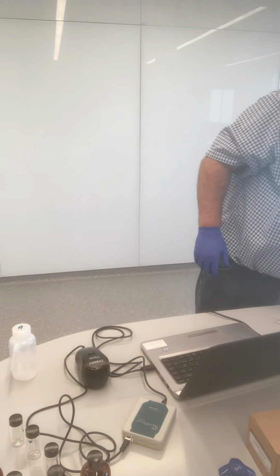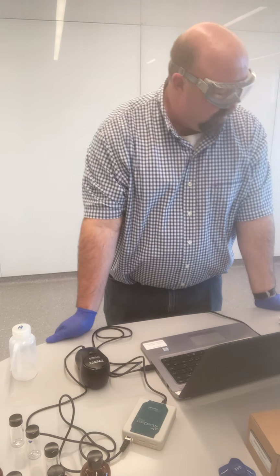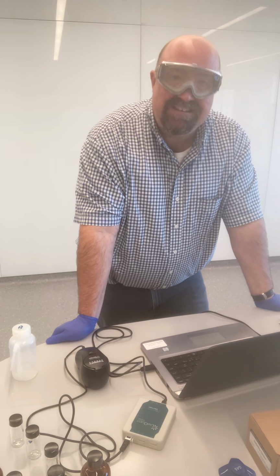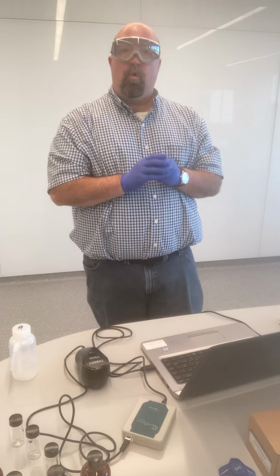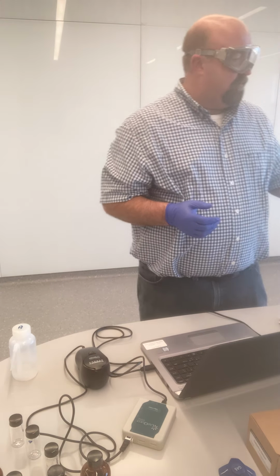And so we're at 500 NTUs. I need to get it down somewhere between 0 and 100. I'm going to do a 1 to 10 dilution. I'm going to do a 10-fold dilution of sample spot 4. There's a couple different ways to go about that.